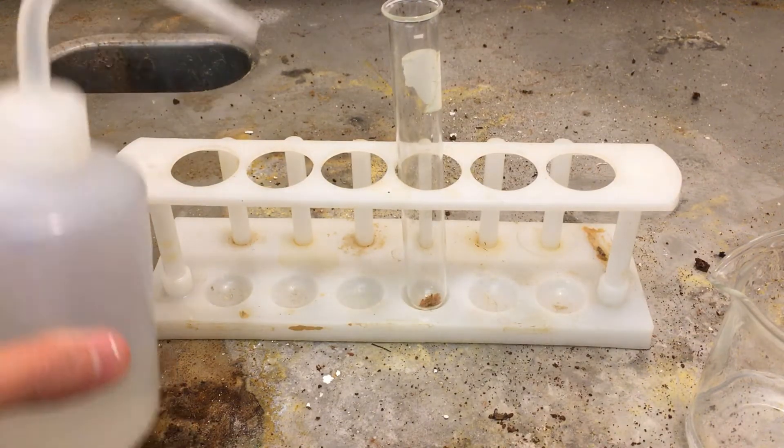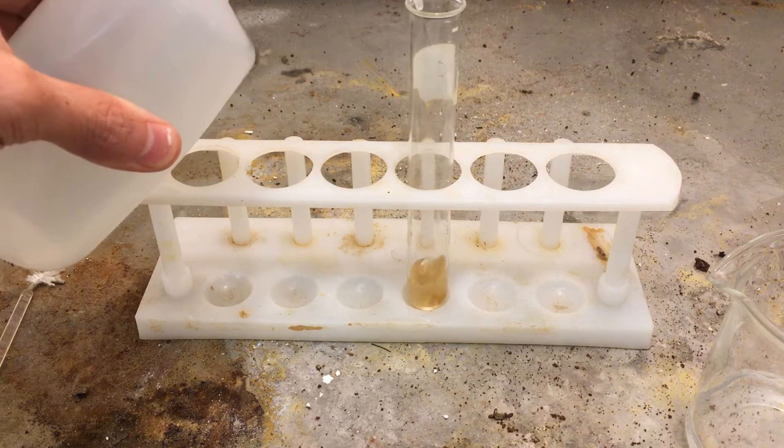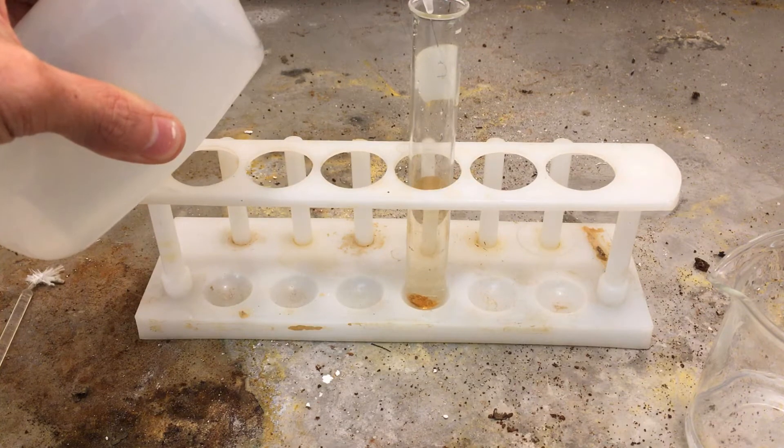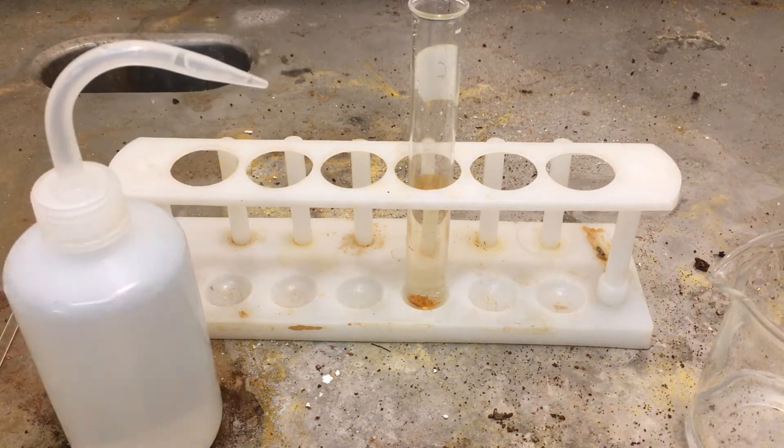By adding a little bit of water, I should be able to dissolve a good amount of it. You notice that the solid itself was already fairly orange. It's about half filled now.